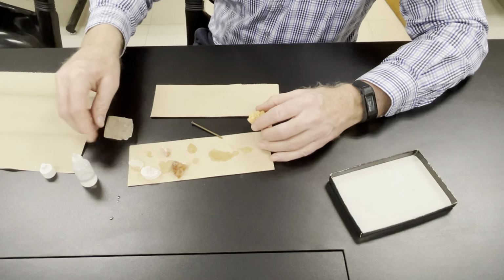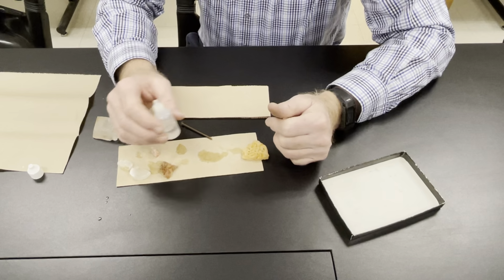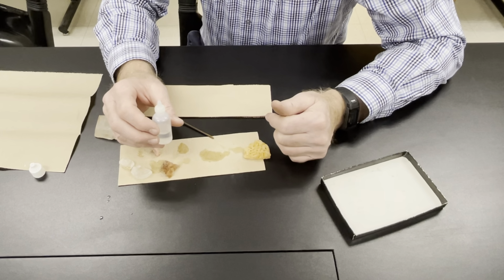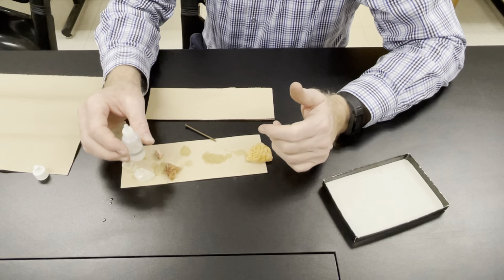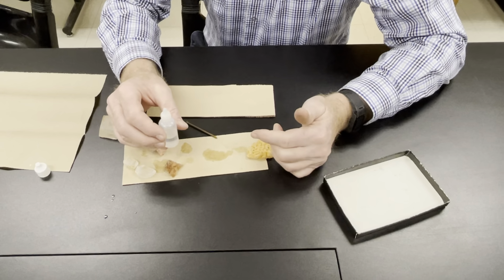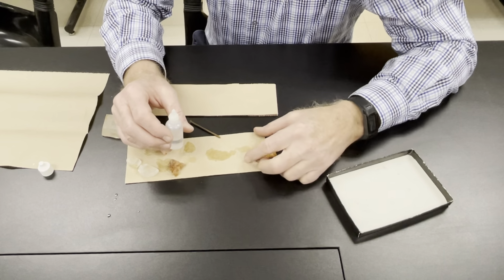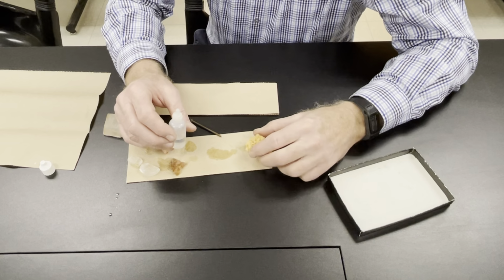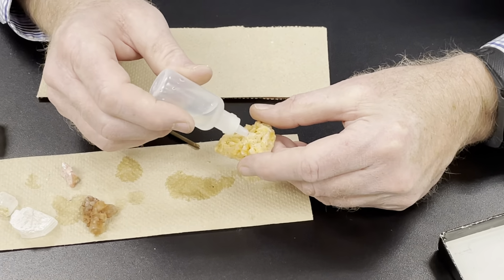What does the acid reaction turn into? So what the acid does is it breaks up the cation from the anion, so it breaks the calcium from the carbonate, and then that carbonate reacts with the acid to make, what does it make? It makes bicarbonate and it makes CO2. So you're releasing CO2 when you put the acid on.